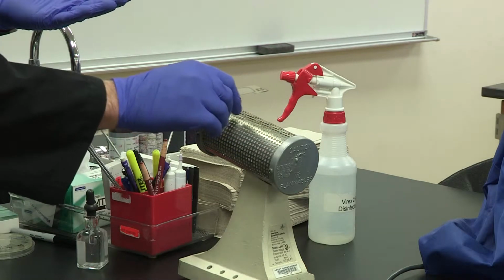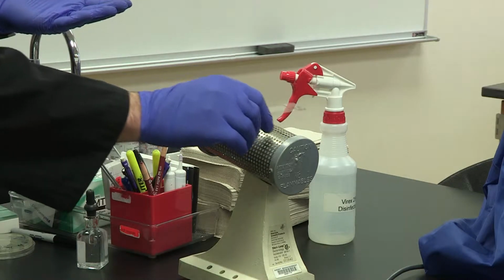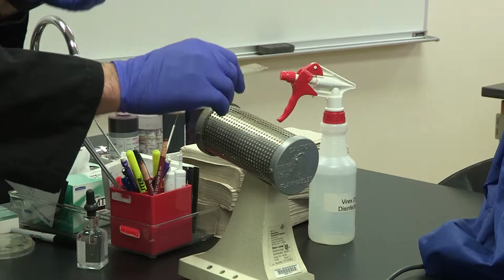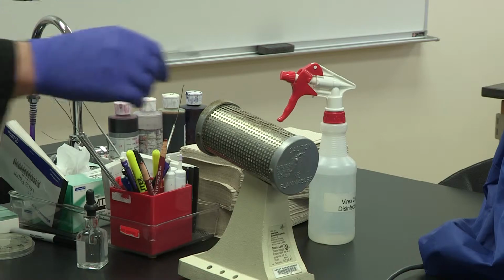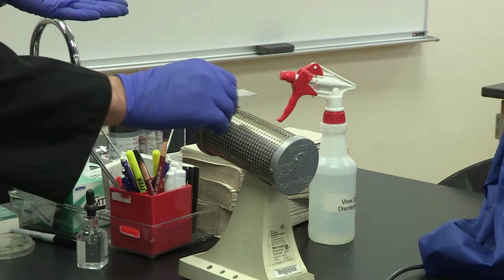And so you don't want to necessarily burn your fingers off in this step. You still need your fingers for the rest of the stain. So again, about 15 to 20 seconds will be enough to fix the bacteria to the slide. Remember, heat fixation is needed, because if I start putting dyes on here right now, the bacteria will simply run off the slide. So you want to make them stuck to the slide, but not melt them.